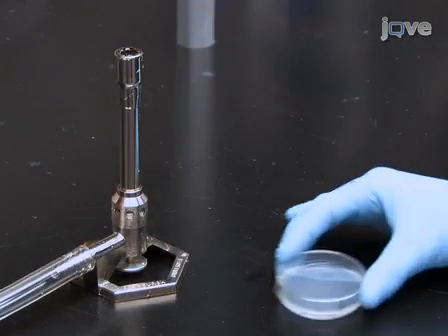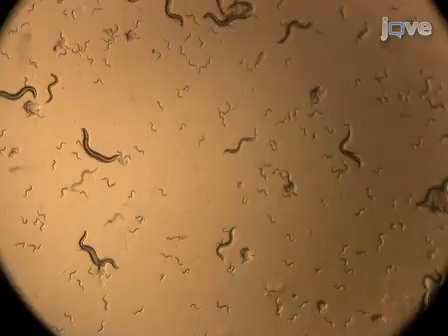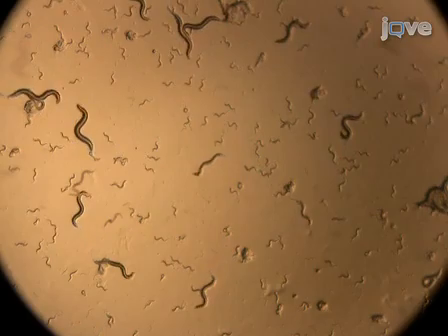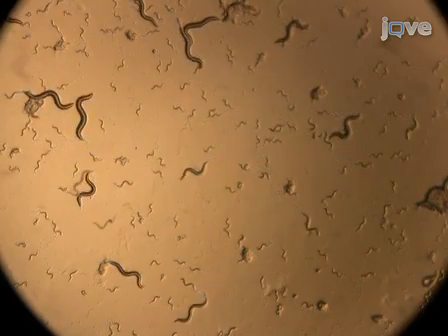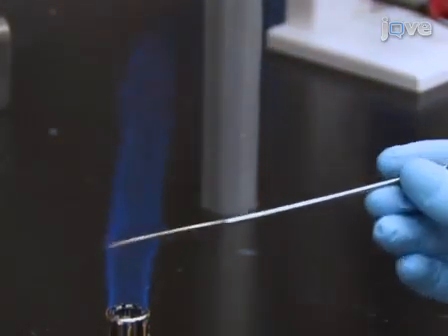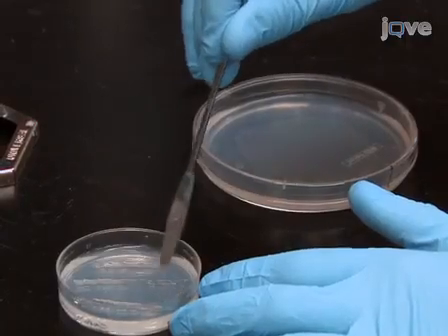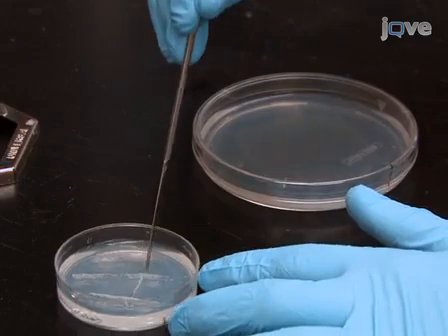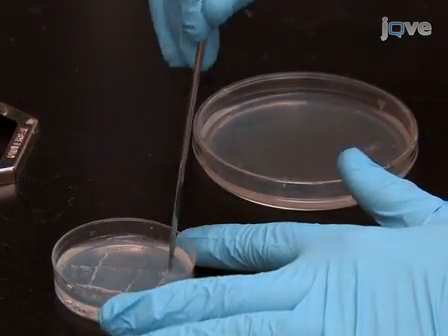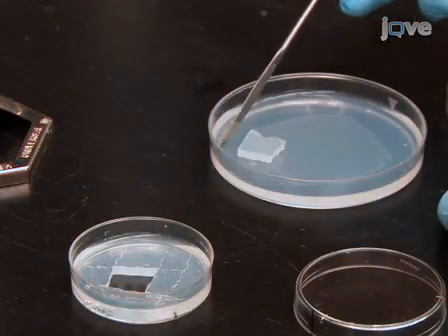To generate an age-synchronous population of worms, begin late afternoon on day -6 with a 5 to 10 day old NGM plate on which the worm population consists mainly of starved L1 larvae. Sterilize a metal spatula by shortly heating it over a Bunsen burner. Let it cool. Then use the cooled spatula to cut out agar chunks from the plate containing the starved worms. Transfer several of these chunks onto a fresh 10 cm NGM plate seeded with OP50.